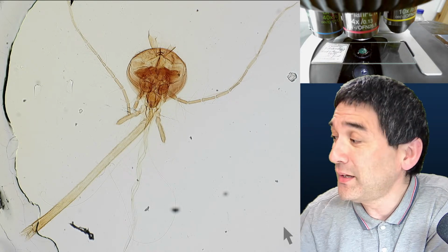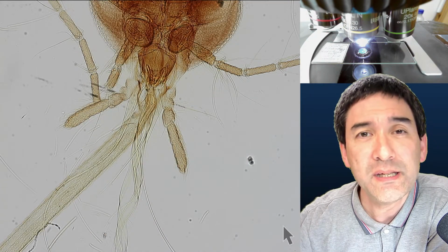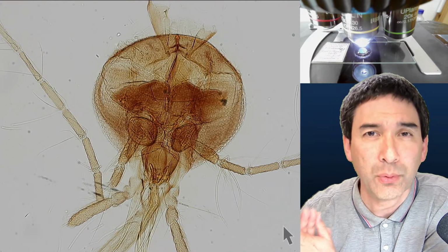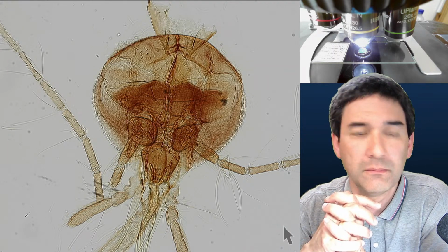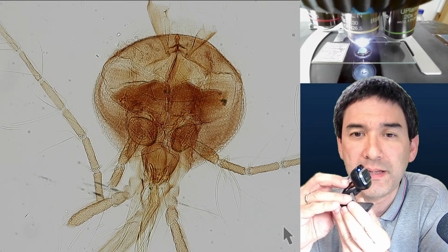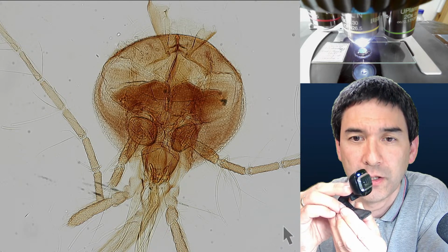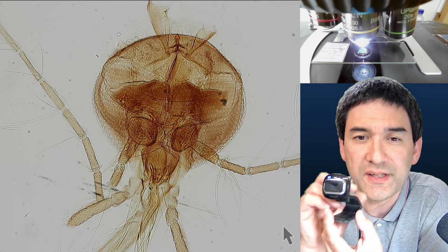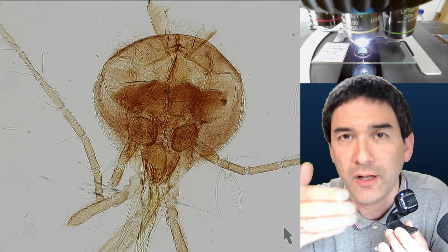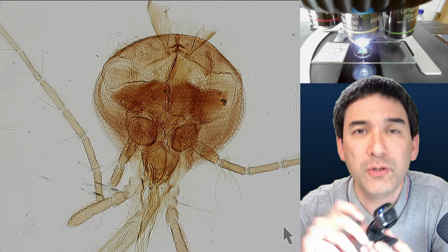The reason why this program works so well, and I know there are other panorama programs out there, is a fundamental difference that I would really like to explain because it's important for understanding. I'm going to use this webcam as an example. If you want to make a panorama, what this software assumes is that you put your camera on a tripod and rotate around a central axis, and then the software stitches the images together. But this is not suitable if you want to make images that are larger also vertically.